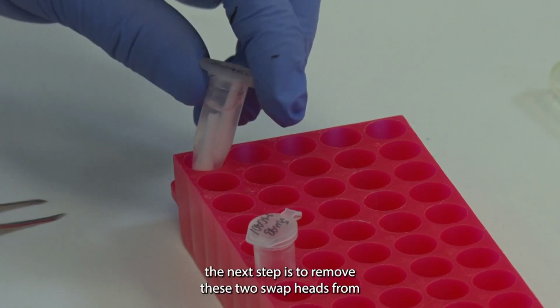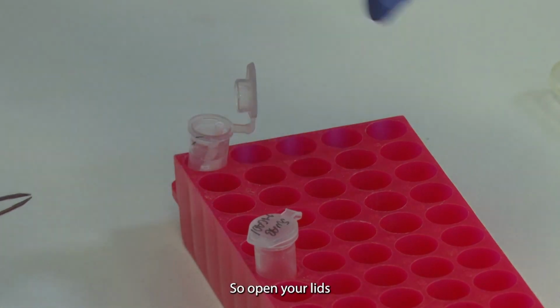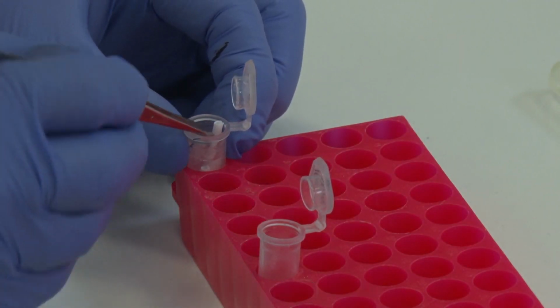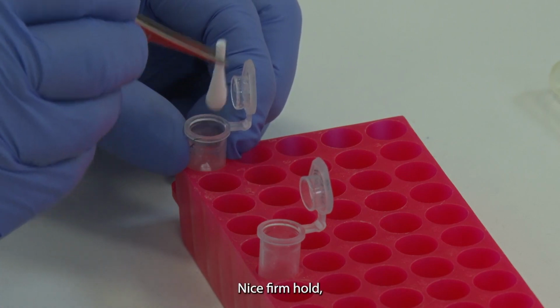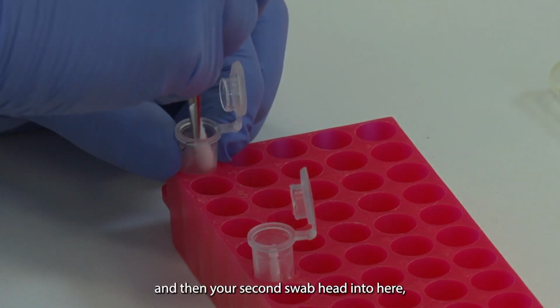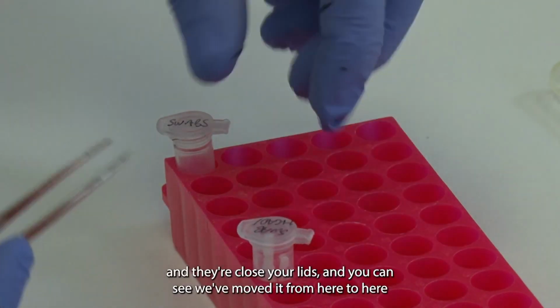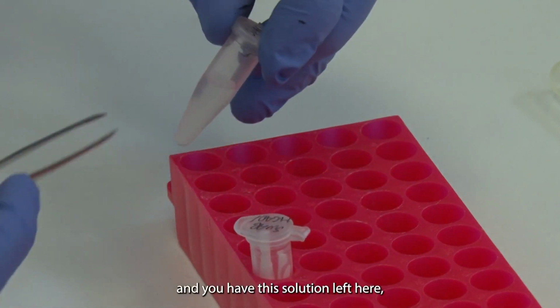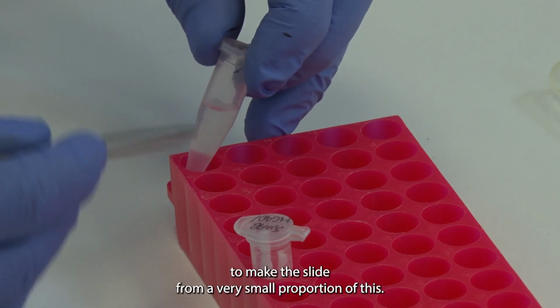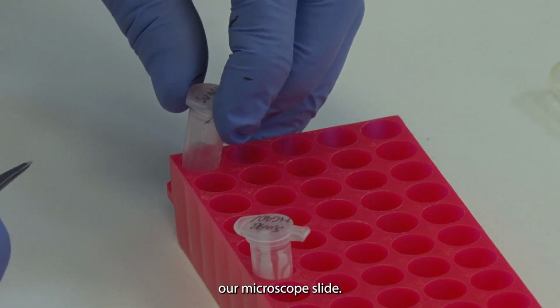The next step is to remove these two swab heads from this Eppendorf into this Eppendorf. So open your lids and using a clean, sterile tweezers, nice firm hold from here to here, and then your second swab head into here. And then close your lids, and as you can see we've moved it from here to here, and you have this solution left here, and this is what we're going to make the slide from, a very small proportion of this, and that's what's going on our microscope slide.